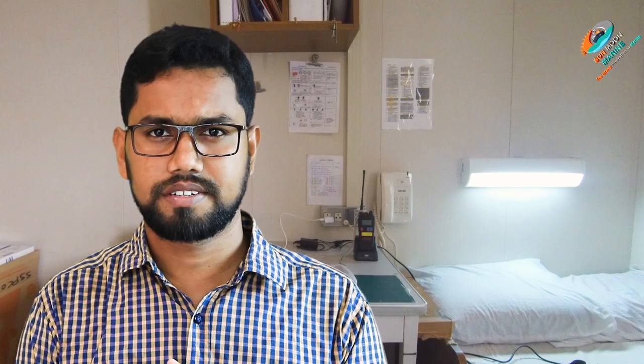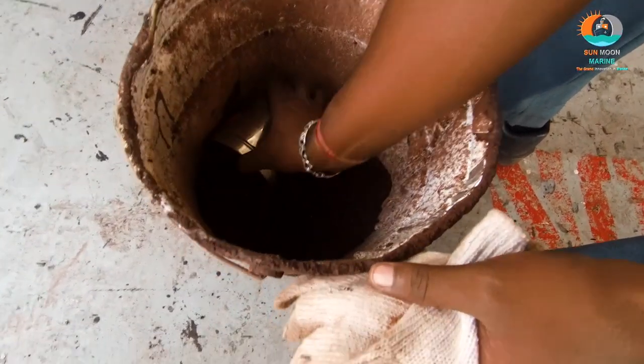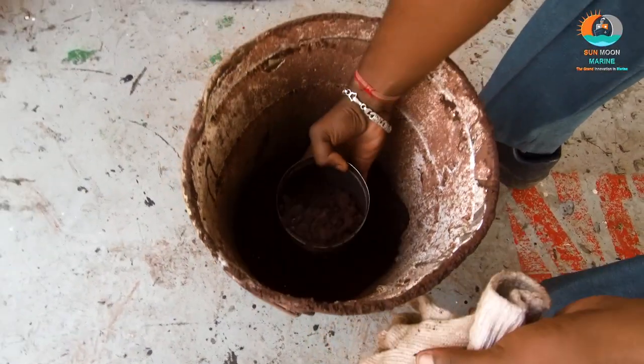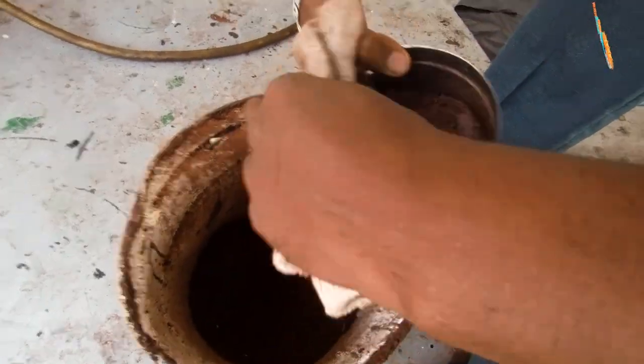According to Section 8.4 of the IMSBC Code, a shipmaster may carry out a check test to approximately determine the possibility of flow on board ship or at the dockside by can test. Half-fill a cylindrical can or similar container of half to one liter capacity with a sample of material.